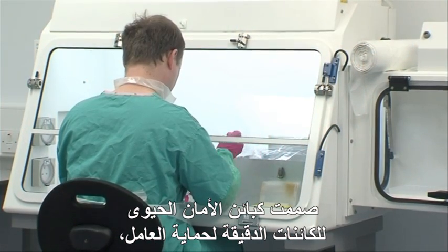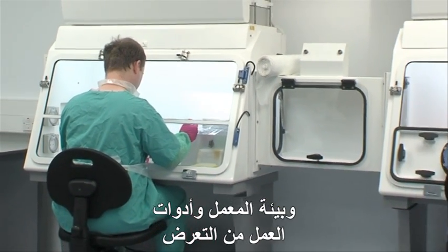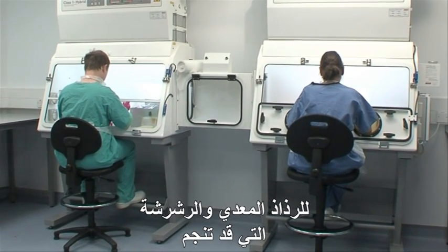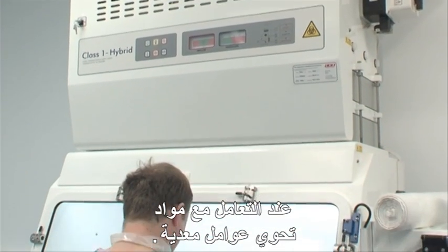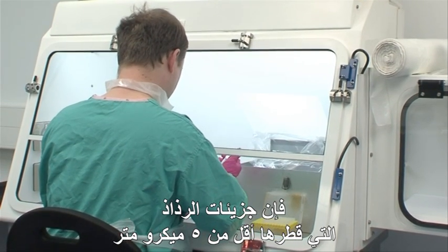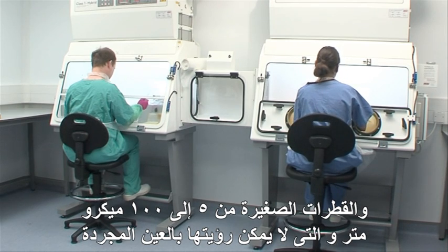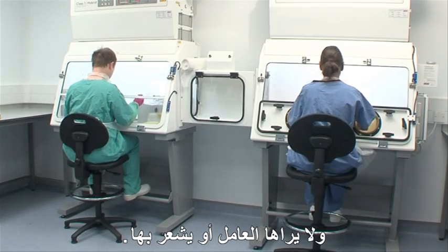Microbiological safety cabinets are designed to protect the operator, the lab environment and work materials from exposure to infectious aerosols and splashes that may be generated when working with materials that contain infectious agents. Aerosol particles of less than 5 micrometres in diameter and small droplets of 5 to 100 micrometres are not visible to the naked eye, so the operator is unlikely to be aware of them.